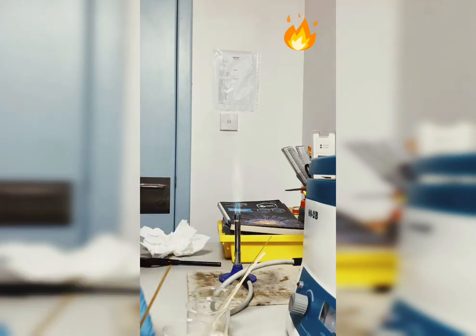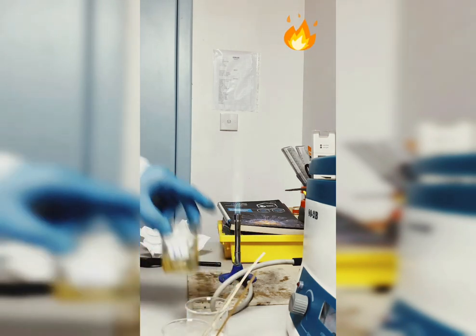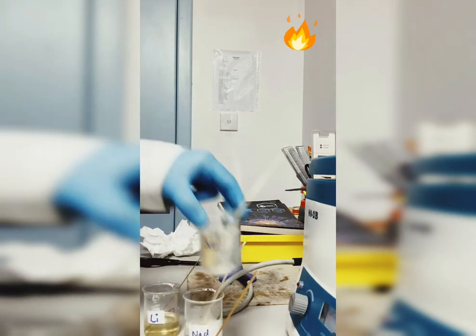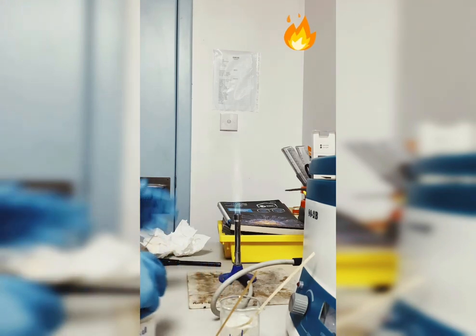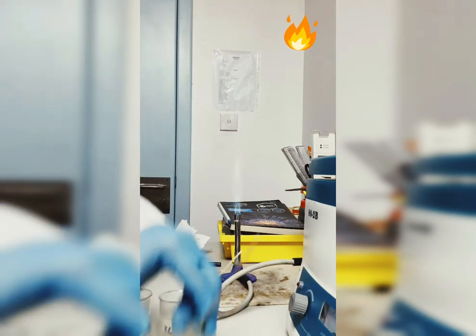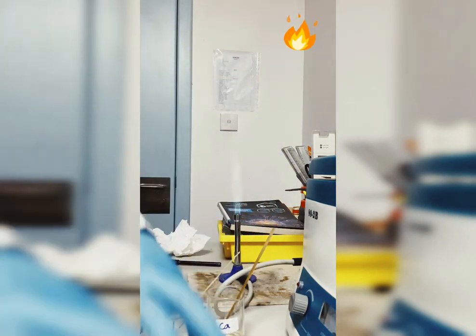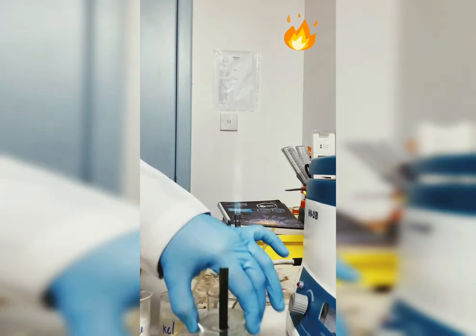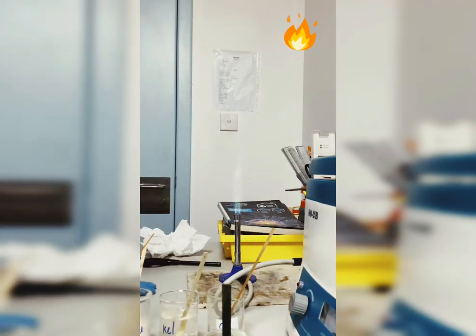The most commonly used chemicals in all experiments are lithium, sodium, potassium. That's all from group 1, in the same series going down the group. Calcium from group 2 and copper. From its color you can know it. We have prepared solutions of these in the form of salts, because these solutions are only available when we create them as salt compounds. So we have lithium chloride, sodium chloride, potassium chloride, calcium chloride and copper chloride.